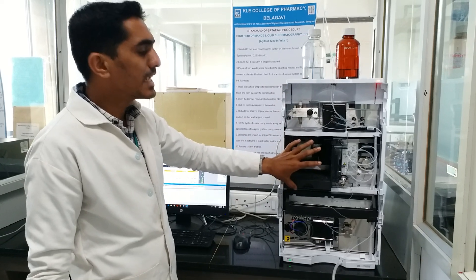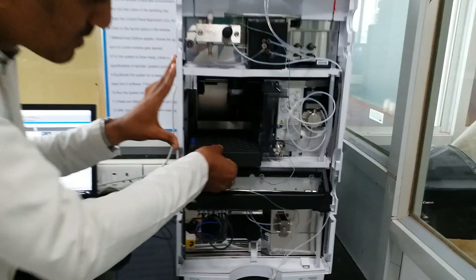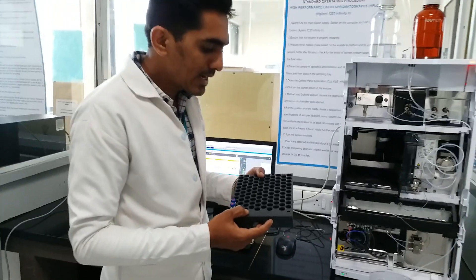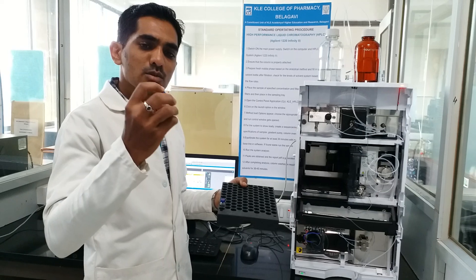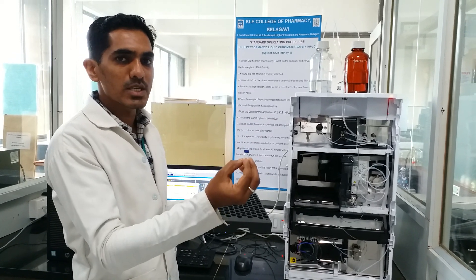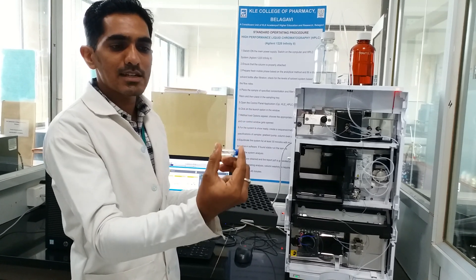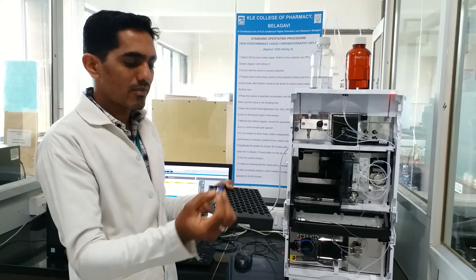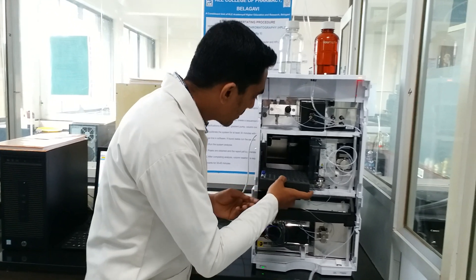Next, after the pumping system, we have the injector port. Here we have an automated sample injector port with trays — this is called a sample tray. This sample tray holds a total of 100 vials; we can put 100 HPLC vials, which are made of glass. We can put our sample to be analyzed here. We make dilutions containing the analyte at different concentrations, filled into the HPLC vials. Around 1.5 to 2 ml of sample can be put into each vial, and after keeping the vials in the tray, it can be inserted and the instrument made ready for injection.